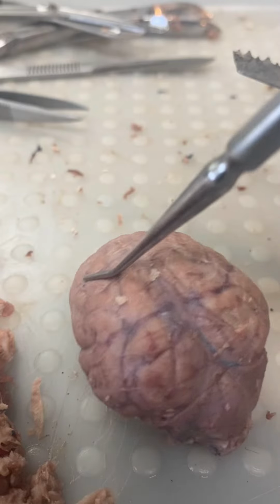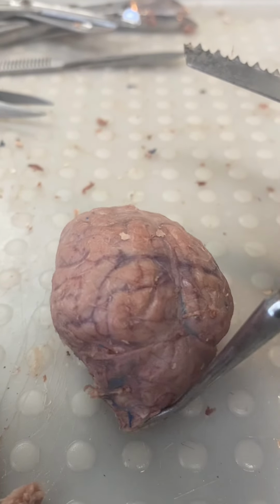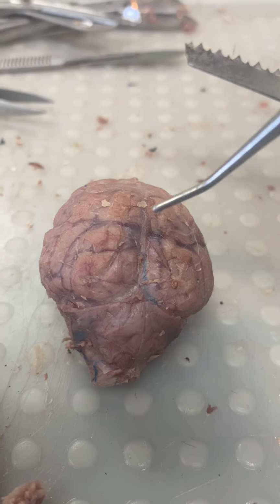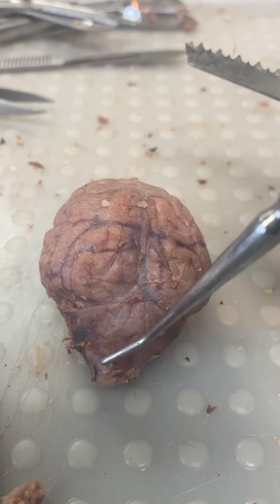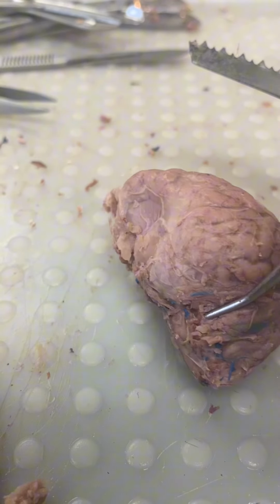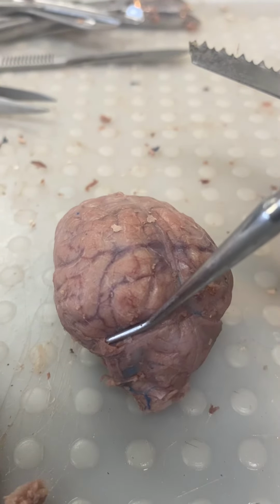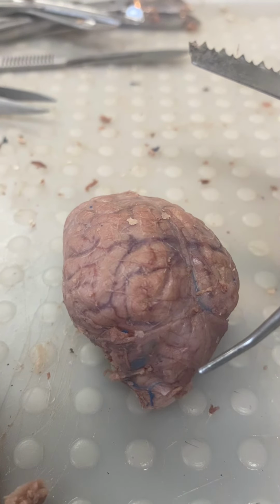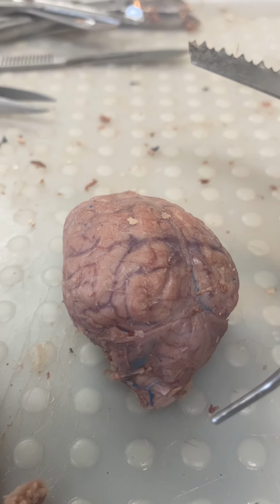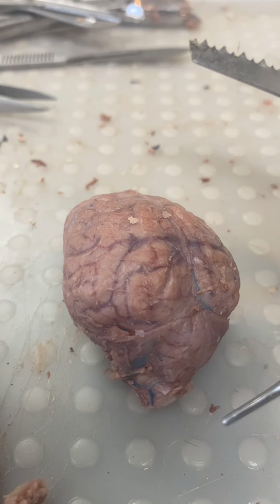On the back side here, we have the cerebellum, under the occipital lobe of the cerebrum, which is this part, separated from the brainstem by the fourth ventricle, and it's made of mostly white matter. It receives sensory input from the body and the position of body parts, and it sends motor signals to produce smooth coordinated movements, for example, playing piano.